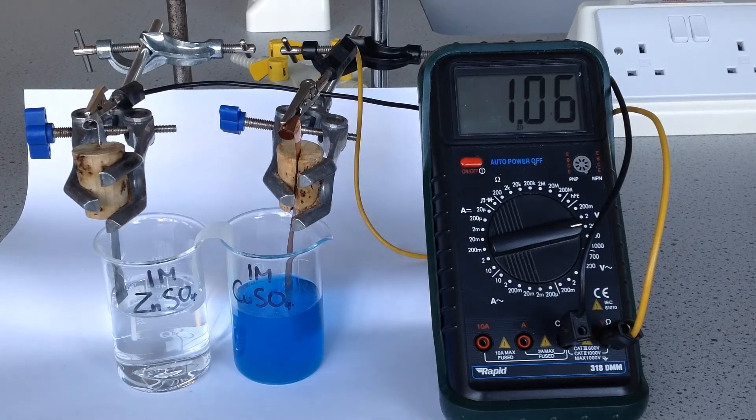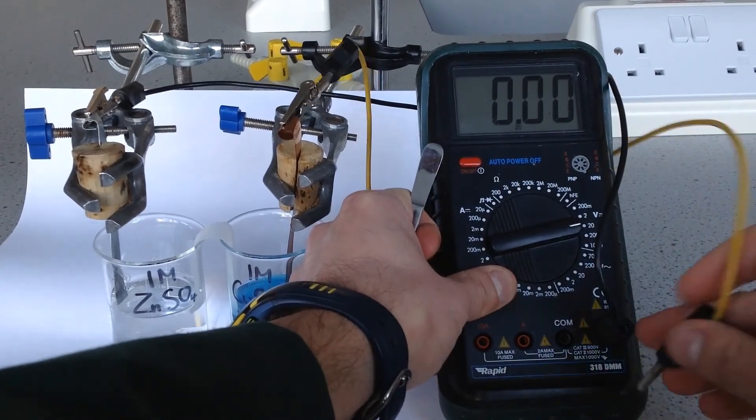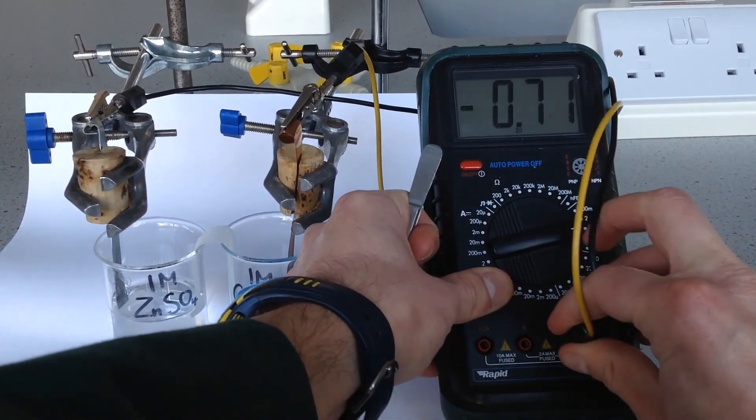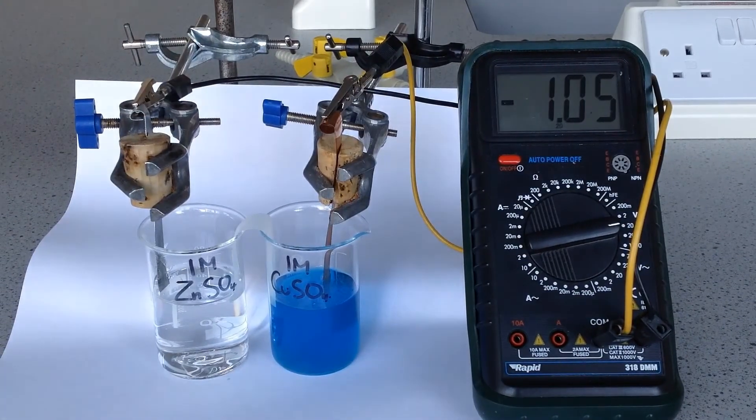If you were to have these the other way round, you'd get a negative reading of the same value.